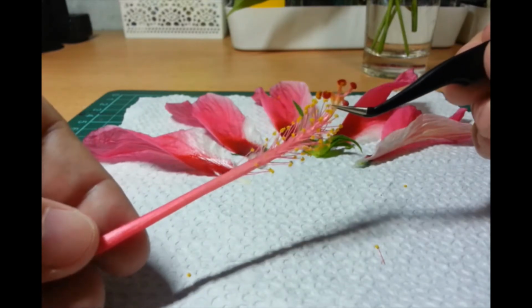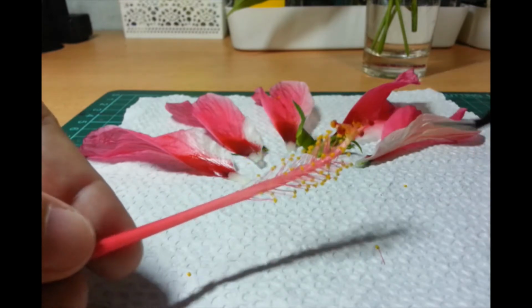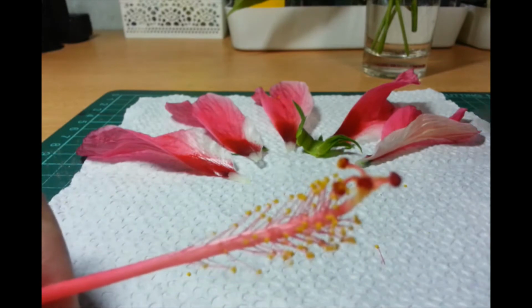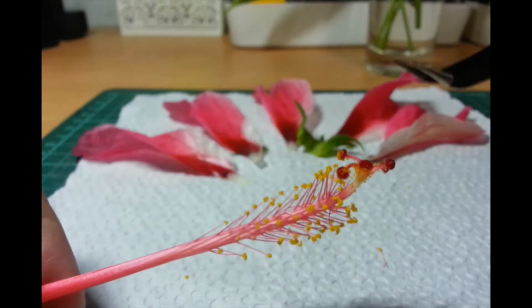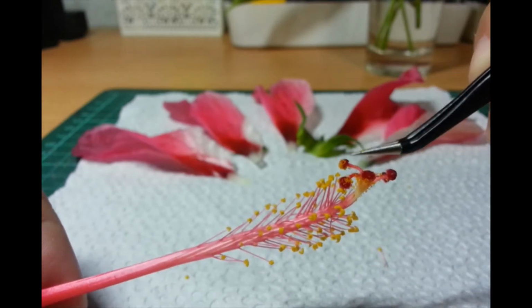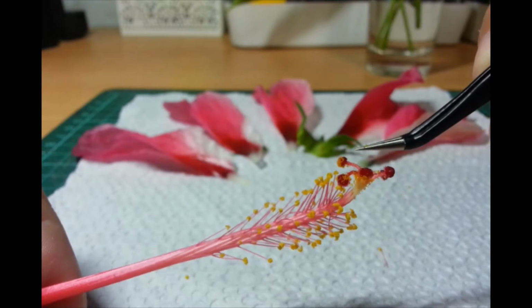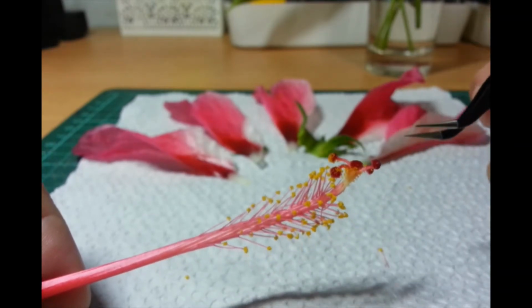Okay. So, I think we need to dissect again. So, kita nyo dito. Kita nyo ba? Meron ng pollen na napunta na dun sa female part. So, yun yung nangyayari during pollination. The pollen is transferred to this part here. Yan yung nagre-receive ng pollen. Okay? Which eventually travels down to the eggs later on.